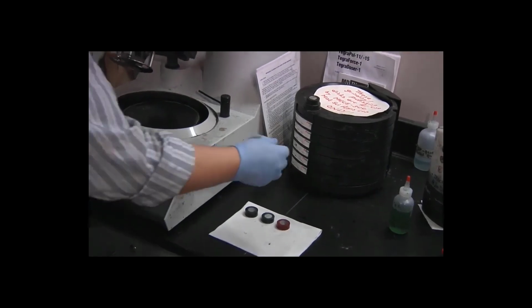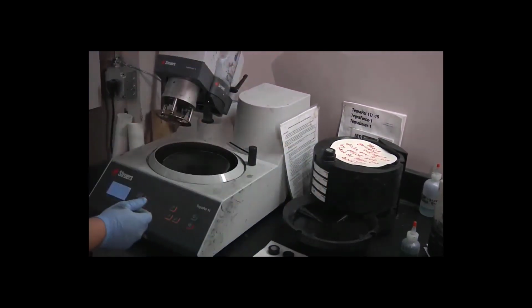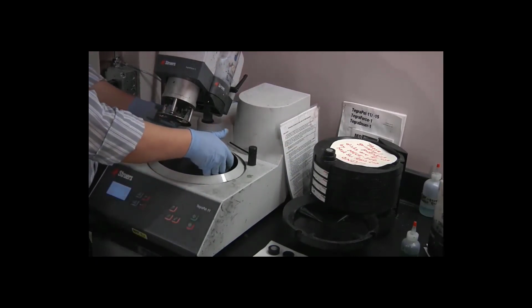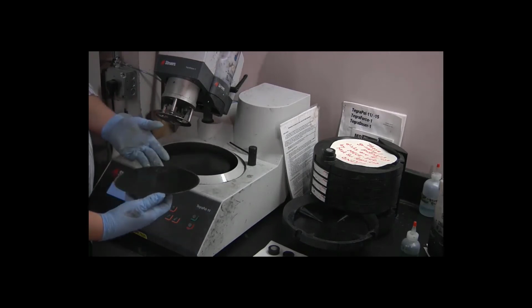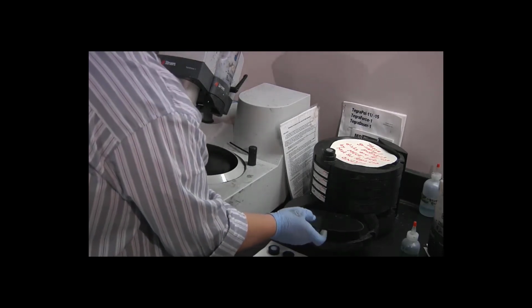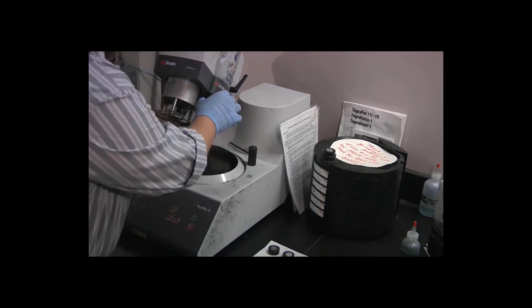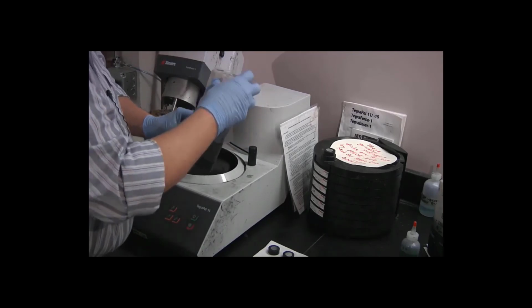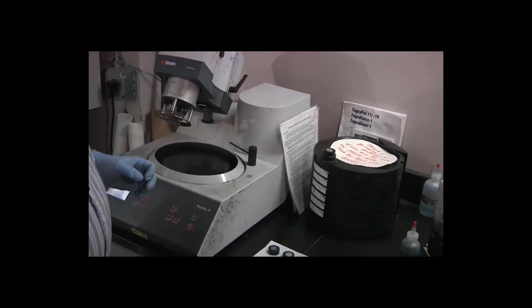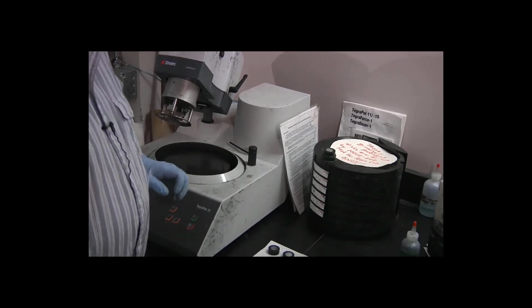So again, put the polishing disc directly back into the carousel. Do not rinse it off. And avoid touching the top of the disc if at all possible. Remove the doser bottle. Put it back in its place. And again, I want to get a damp paper towel, wipe the underside of the mover plate and the turntable.